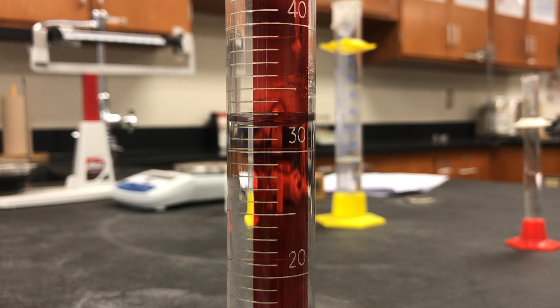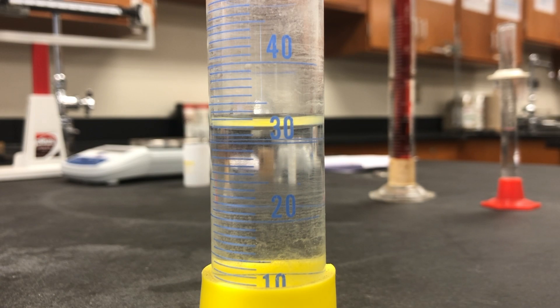First we're going to take a look at three different graduated cylinders that have set amounts of water in them. Observe the meniscus of the water in the 10 milliliter graduated cylinder at eye level. Record the volume in milliliters in your data tables to the accuracy of the 10 milliliter graduated cylinder — that means estimate an extra digit beyond the smallest increment for proper sig figs.